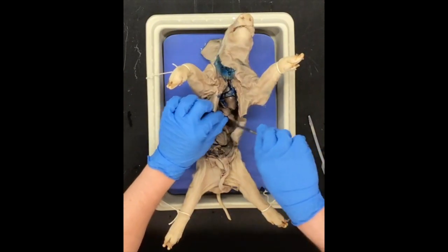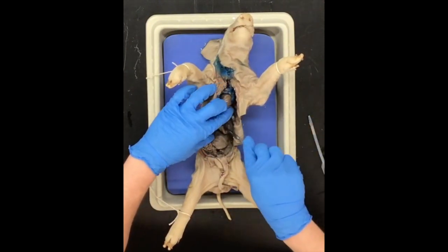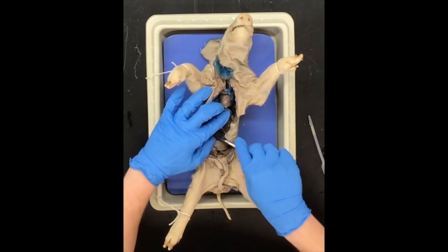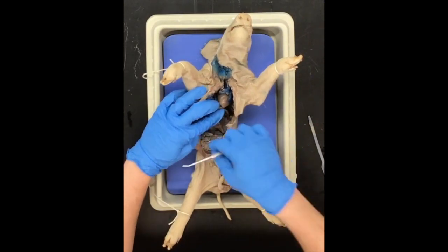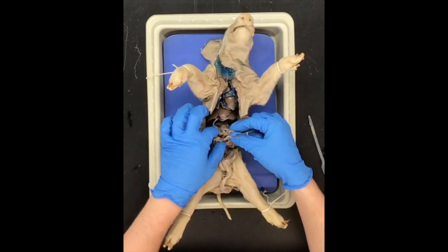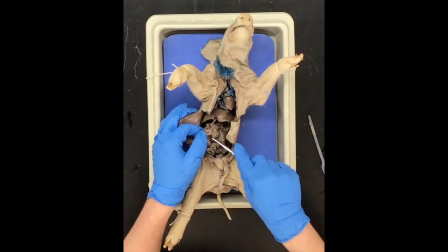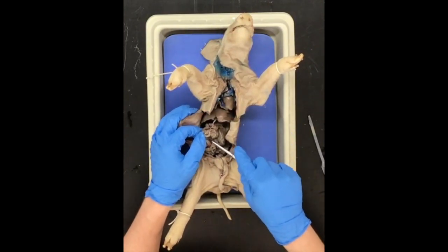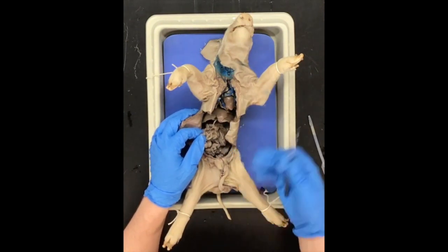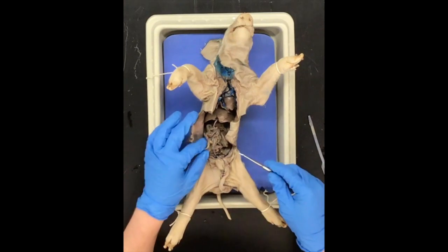Now I was talking about the small intestine — let's talk about that a little bit. Here we have the stomach, and right after the stomach it leads into the small intestine. That's all of this stuff right here. If I pull this out a little bit, it's all connected by connective tissue — mesentery, though for our purposes that's a little more than we need to know.